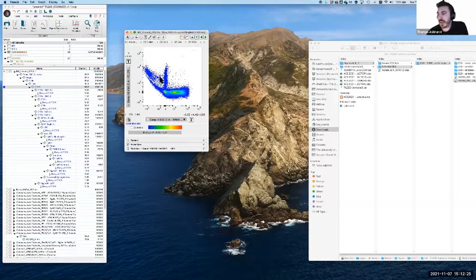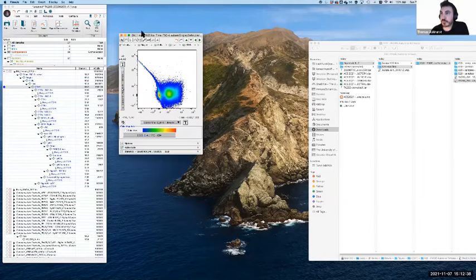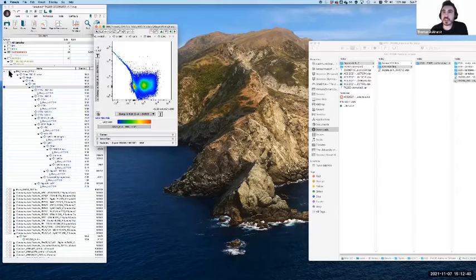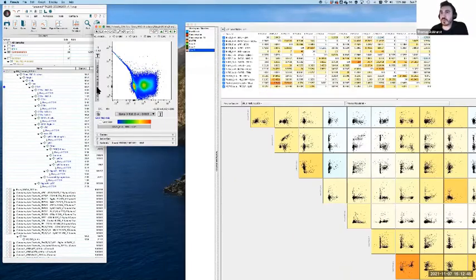But this is where we come back to using those controls, the FMO controls and the single stain controls, and that gives us a way of making that assessment with a lot of clarity. So this is really important. In this case, if it's CD8, that's the issue. If we want to go and correct that, we can open up our matrix. Same rules, BV785, so we find that row, and BV605 as the column, which should be this one. The value there is 20, in case you can't see it.